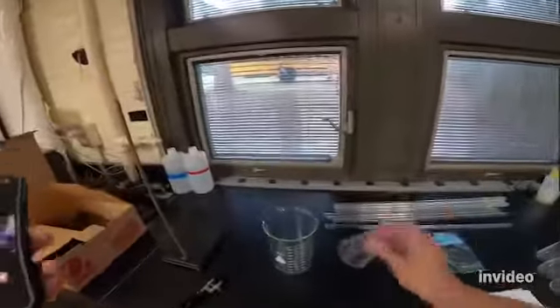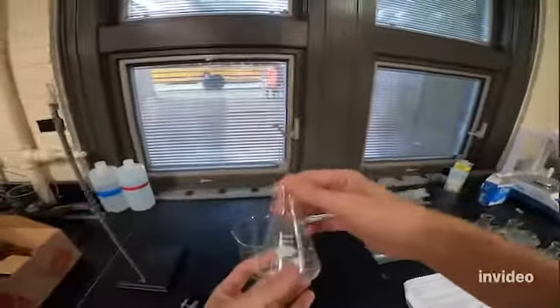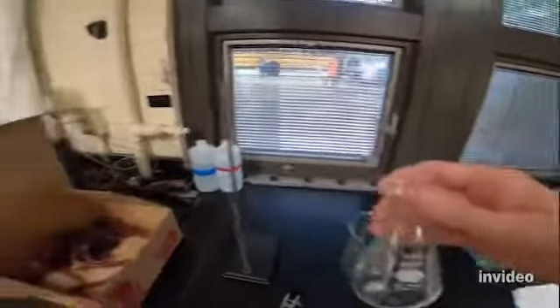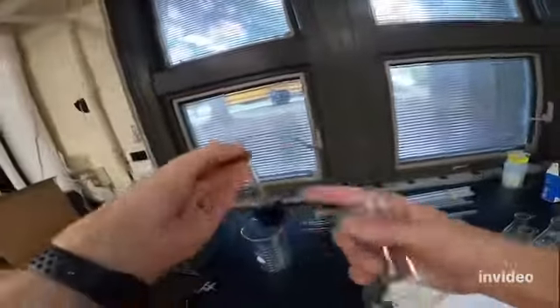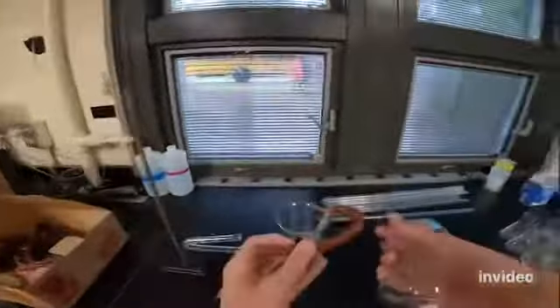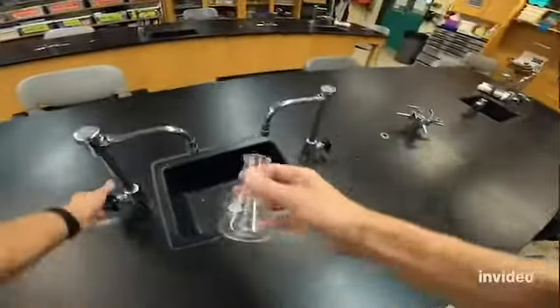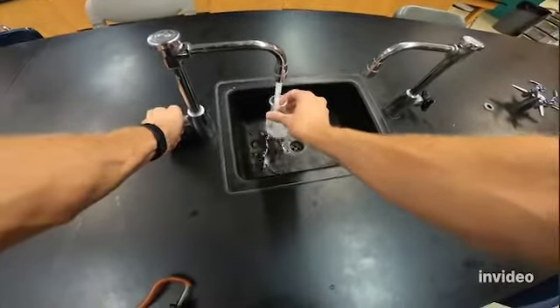So the first thing you're gonna get is a flask like this one. This is an Erlenmeyer flask. You need a 125 milliliter Erlenmeyer flask. And then I want you to take one of these stoppers that's connected to a tube. It's got a glass valve there and sort of a J-shaped glass on the other side. And so the first thing we're gonna do is we're gonna fill this flask with water. We don't need much, so I'm gonna take about, I don't know, 50 to 75 milliliters.